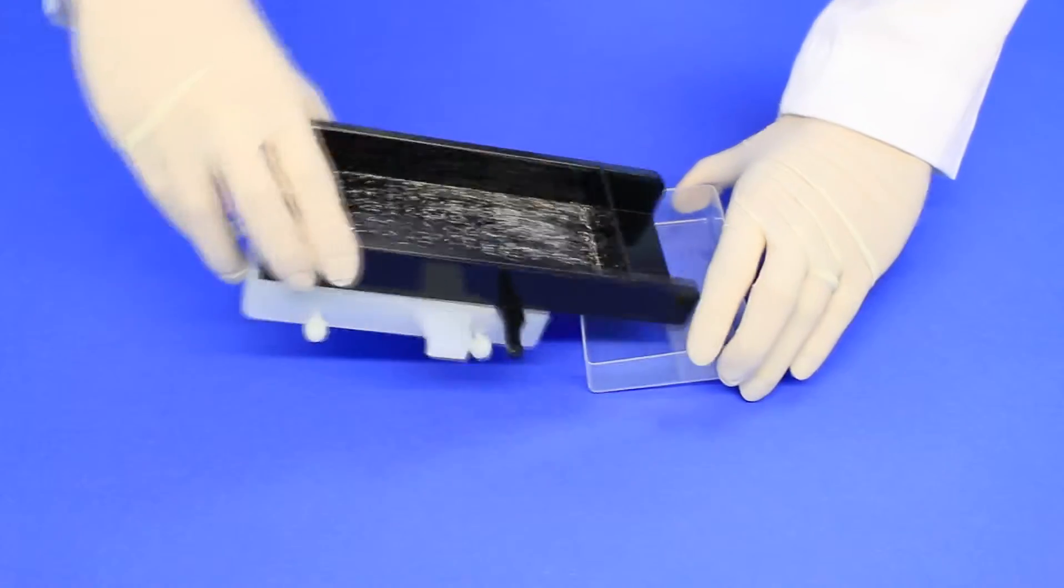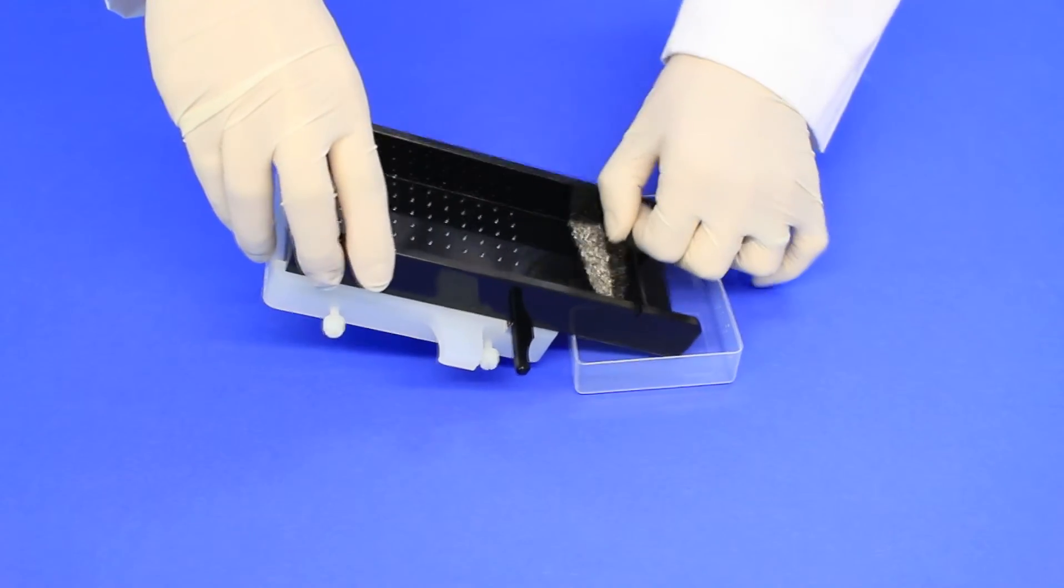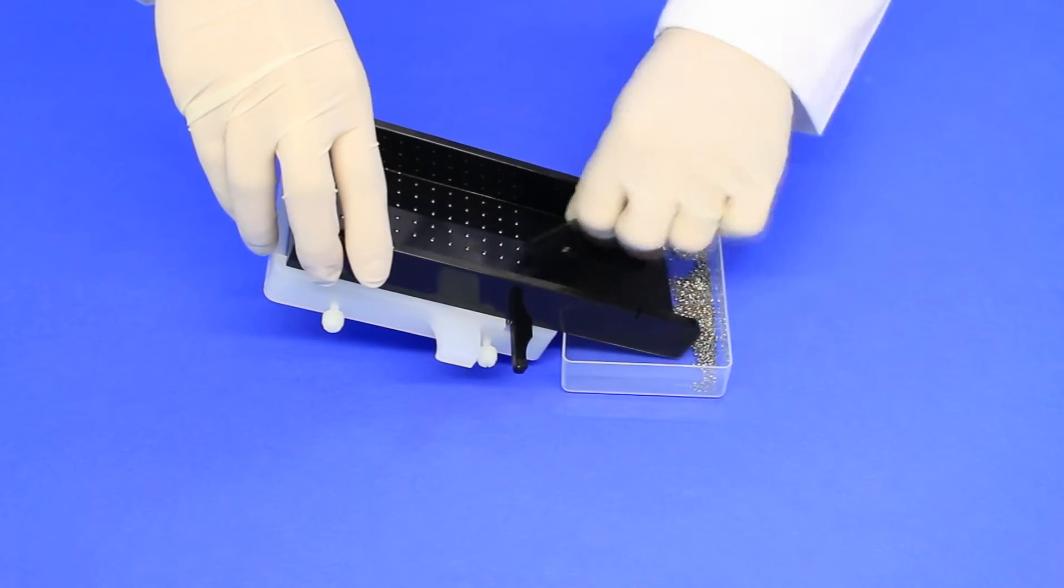Tip the excess stir elements towards the plastic reservoir and remove the stopper plate. Make sure all excess stir elements are removed from the dispenser.